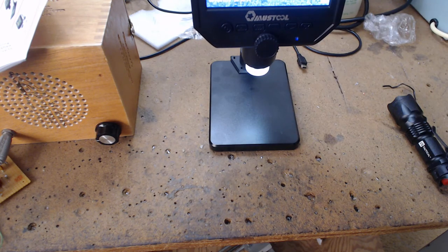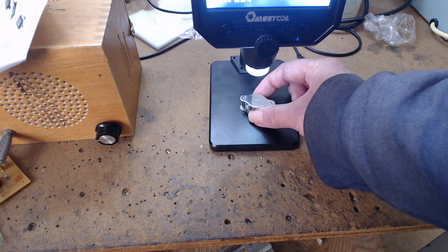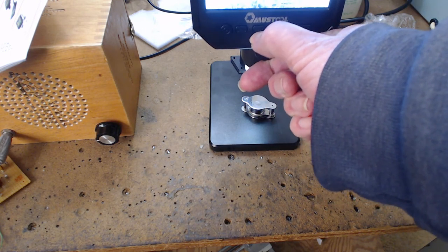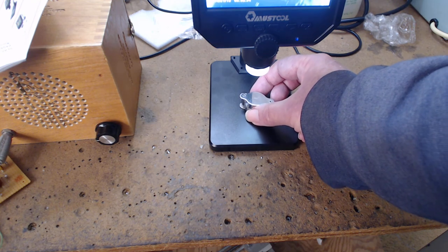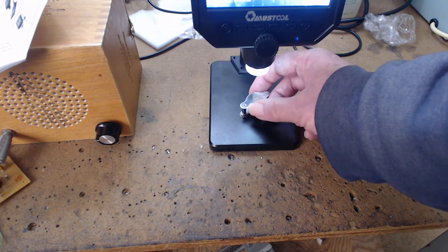Okay, let's see if we can see Japan on this. All right, let's try the brightness. I did focus. Seeing the scratches on the top. There it is. Japan, Japan.